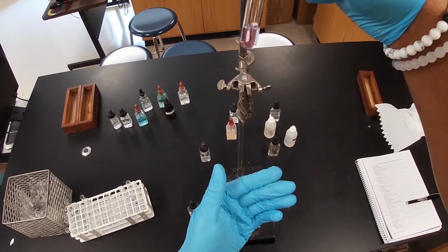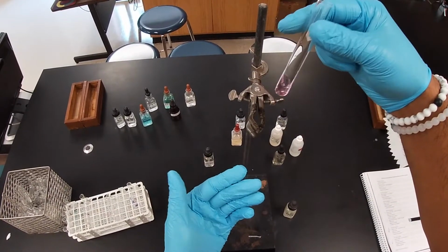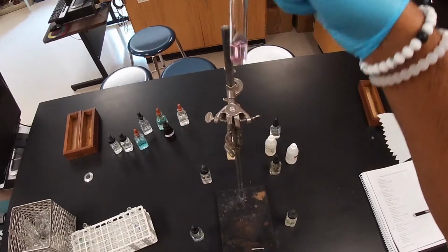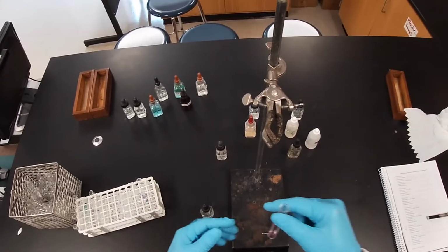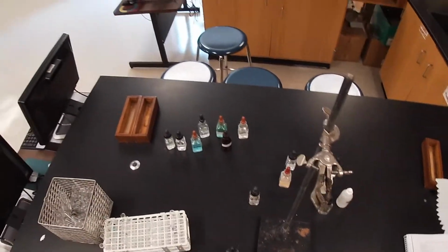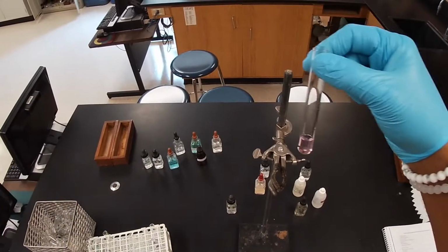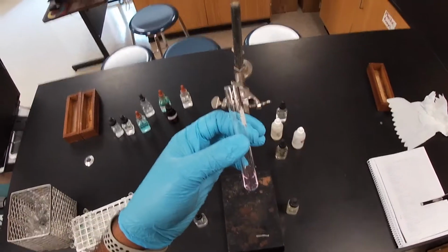But if you can see, there is no precipitate. That little white stuff inside, that's the indicator. Some of these sometimes are laced with indicators so that we can see what can happen. But here in the solution, remember that you have ammonium and you have sodium. Both of them are soluble, no matter what. So when those ions switch, nothing happens, besides the pink that is telling us that the solution is basic. Aside from that, nothing else. Okay, so just go ahead and disregard the pink.